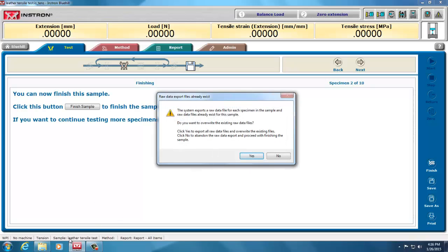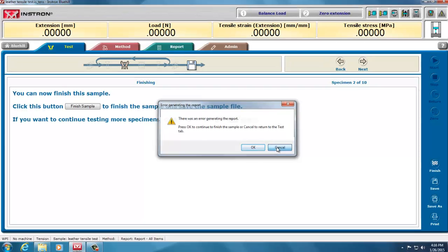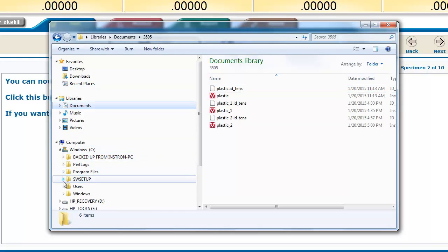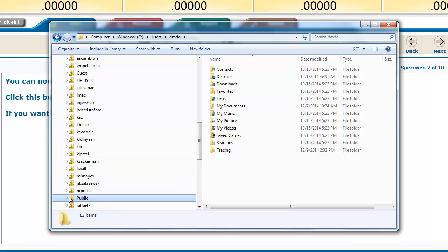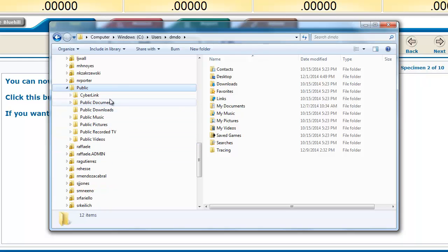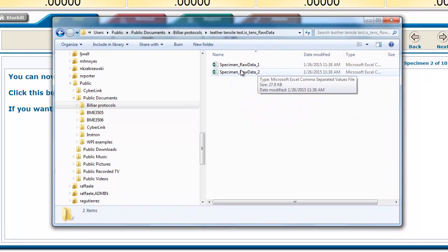So now if I go under computer, users, public, public documents, Billiar protocols, there's my data. Even my raw data is there.